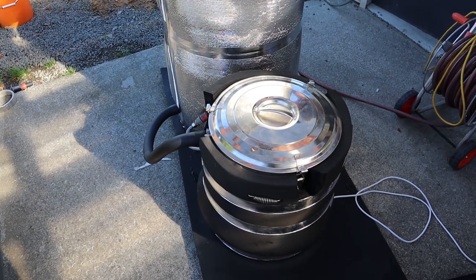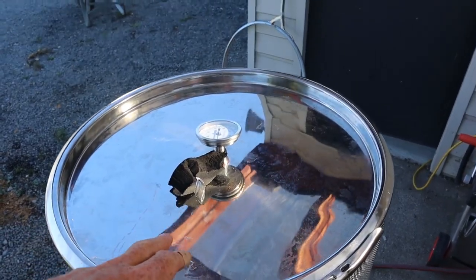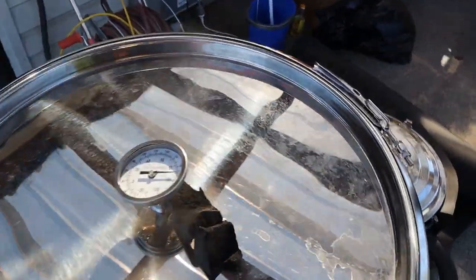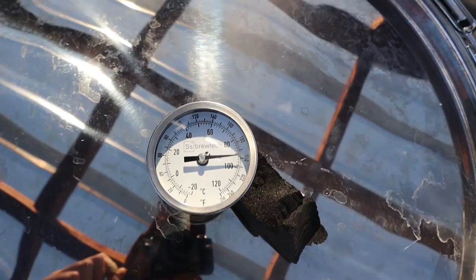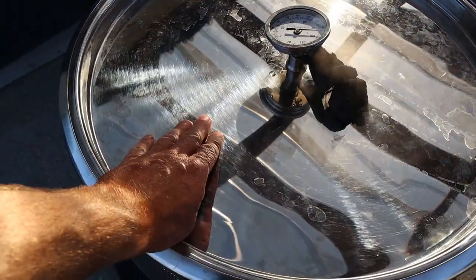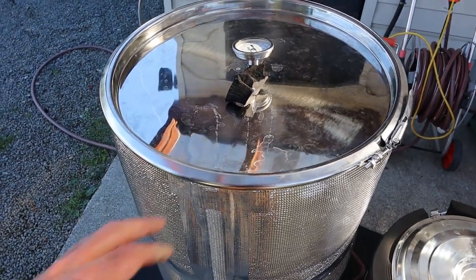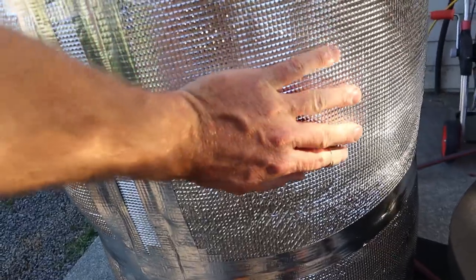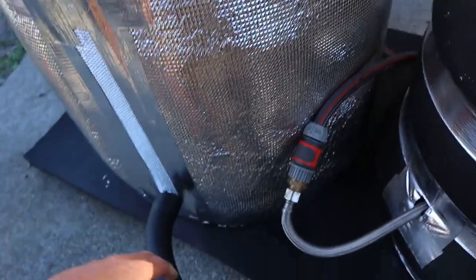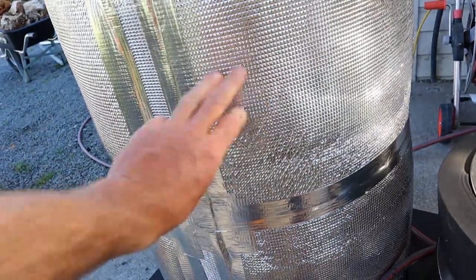It's been running for maybe 45 minutes to an hour now and all is looking well. I've had to put a small spacer under the lid because there's no vent hole in the top — it will slowly build up pressure. You can see the steam coming out and it's sitting at 92 degrees. The top is very, very hot. It's really windy here today, so as the wind gusts across it you can see it drop a degree or two. Once I get that sealed I should be able to push it closer to 100. The insulation on the side has done its job really well — it's only mildly warm to the touch, so we're not getting a lot of heat escaping. There's a little bump where there's a join; if you give it a squeeze you can feel some warmth, so I might double-wrap that to add more insulation.